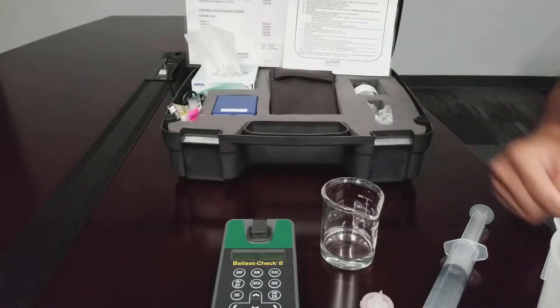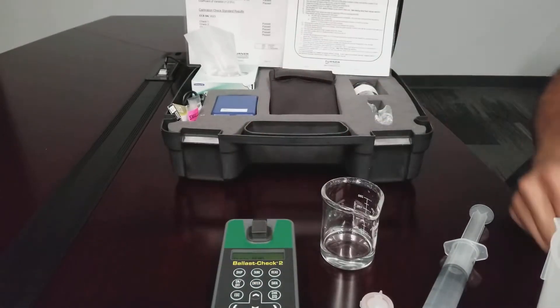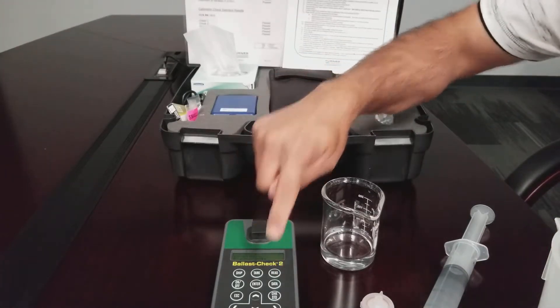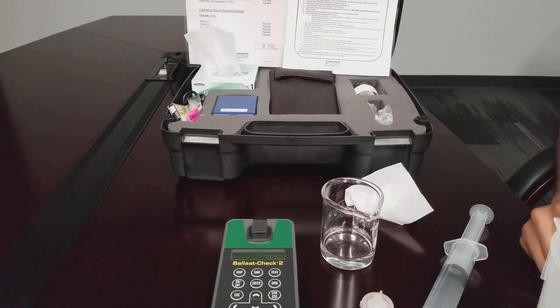Press read. Press enter to continue with the current ship and tank values. Press read to measure the sample and wait for the measurement to complete.